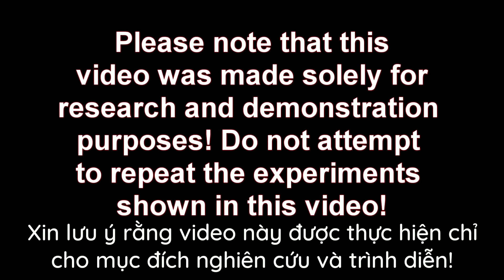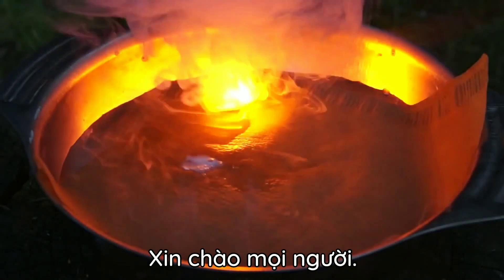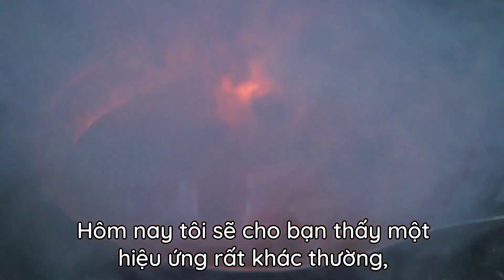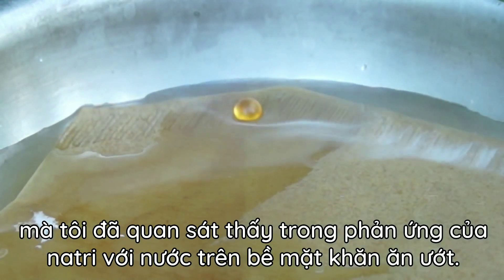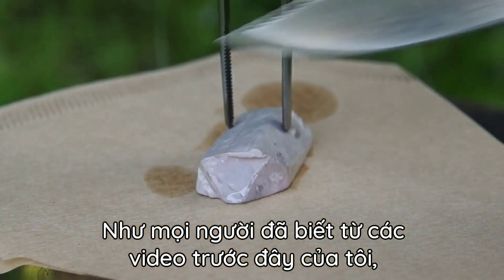Please note that this video was made solely for research and demonstration purposes. Do not attempt to repeat the experiments shown in this video. Hello everyone! Today I'll show you a very unusual effect that I observed in the reaction of sodium with water on the surface of a wet napkin.